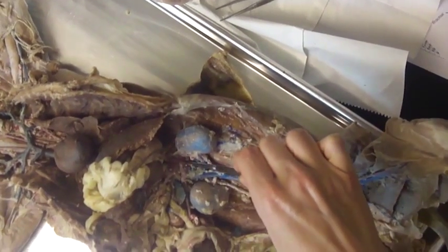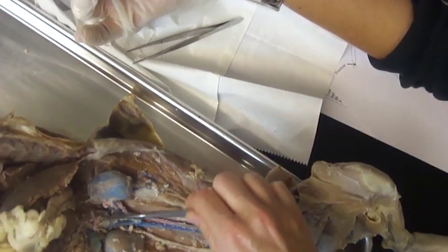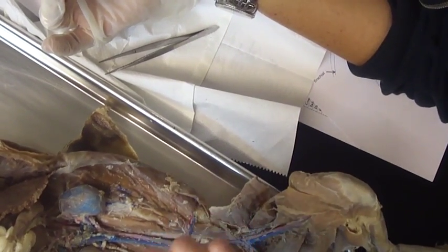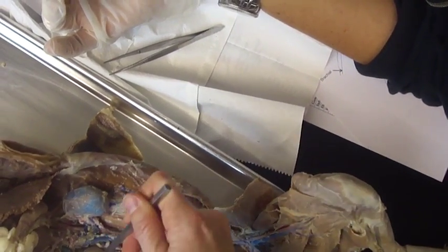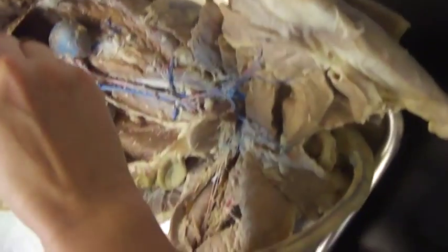The next branch down is the superior mesenteric, and if you follow it, you can see that it's actually going to the mesentery in the intestines. Superior mesenteric.